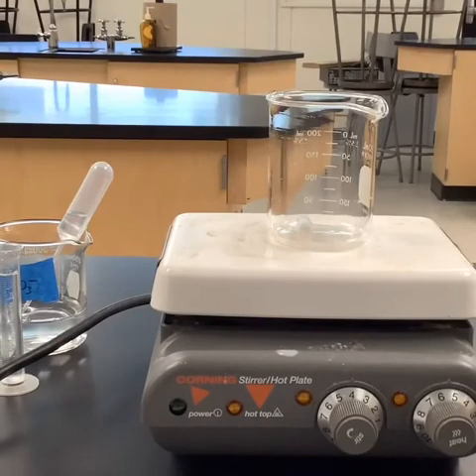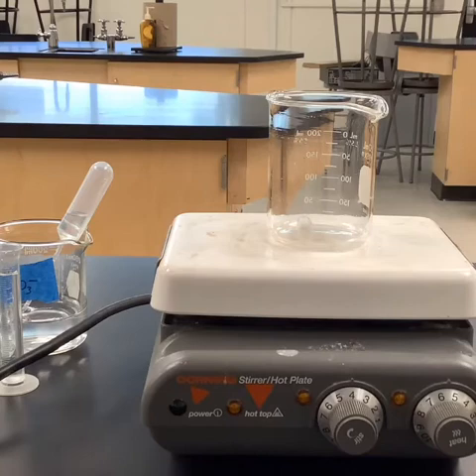Okay, we are starting in on trial 2 here. So for this particular one, remember that I had to decrease the amount of water a little bit because we increased the amount of the iodate. So we had basically 20 milliliters of iodate being used here. So I'm down to 70 so that we maintain that overall 100.